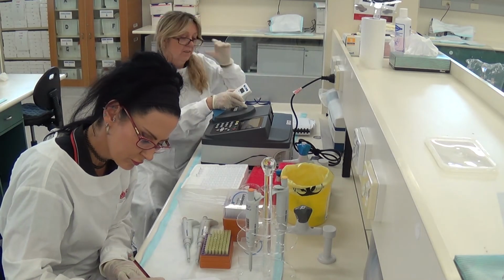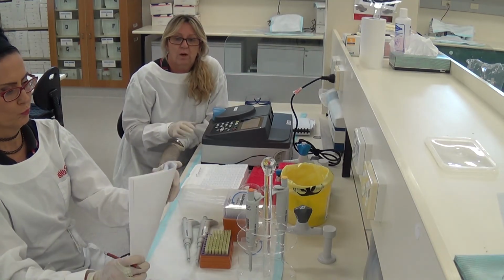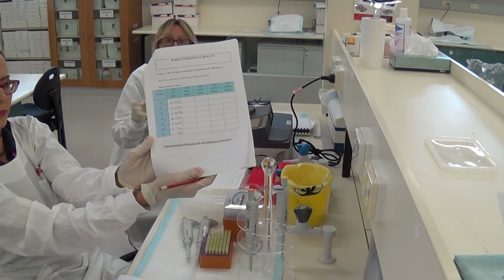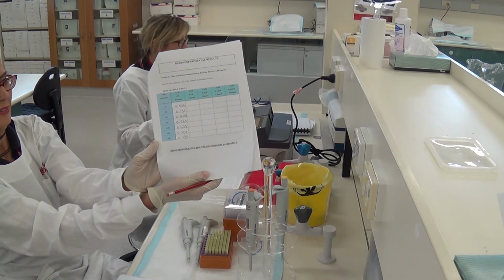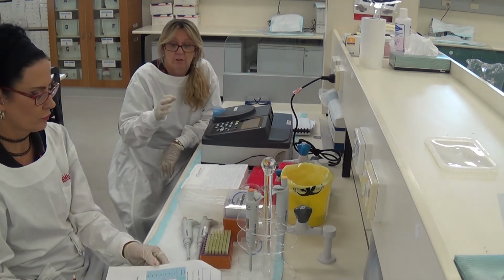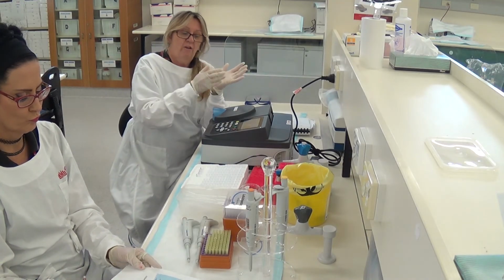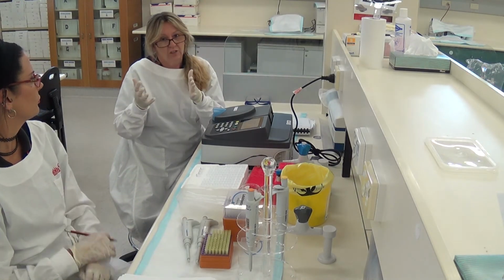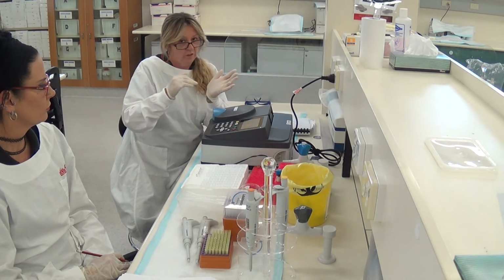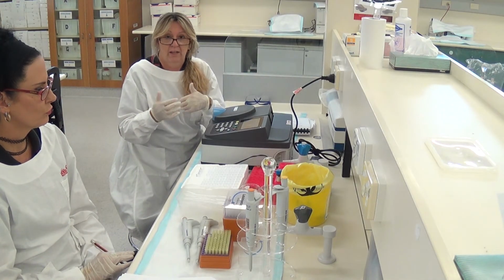0.758. Okay, so that's the first 180 seconds that we've done for the 1 molar ethanol. So your table that you're filling in should look like the one that Kat has filled in here, okay? I want you to see that there's that increase as we go from time 0 through to the 3 minutes, that absorbance is increasing. So our NAD plus is being converted to NADH at the same time that our ethanol is being converted to acetaldehyde. Okay, so now we can see that reaction going ahead.